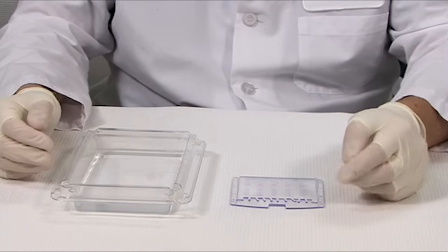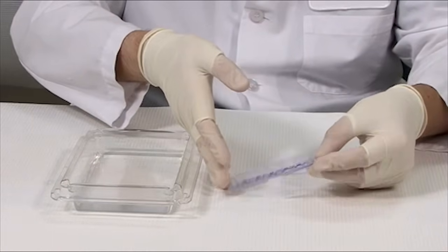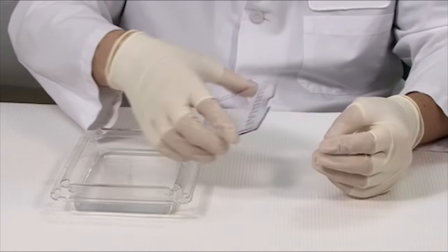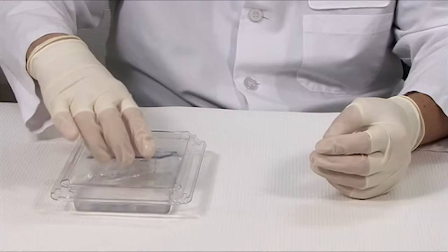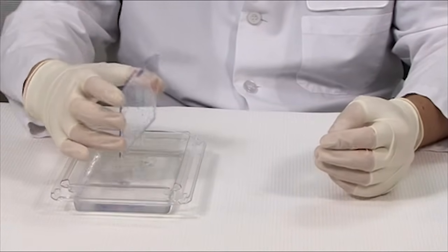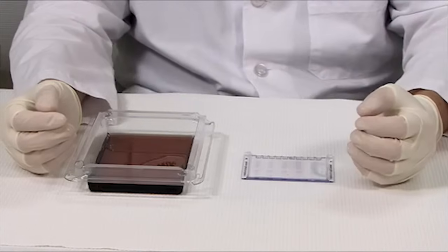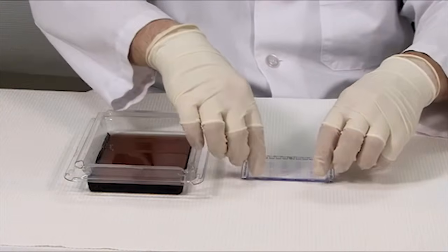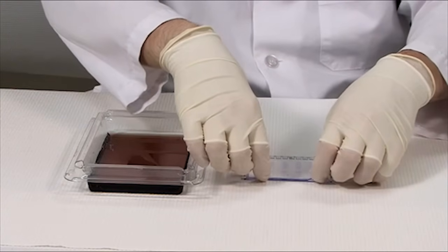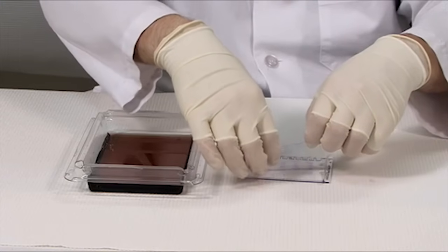One way to remove the gel from the plate is to invert the plate over a buffer filled tray, and the gel should peel from the plate into the buffer. The other way to remove the gel from the remaining plate is to pick it up from the bottom and gently place it into your staining solution.